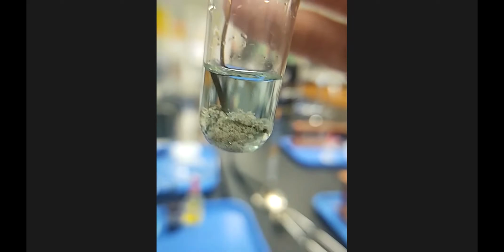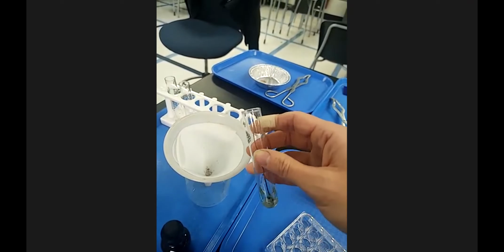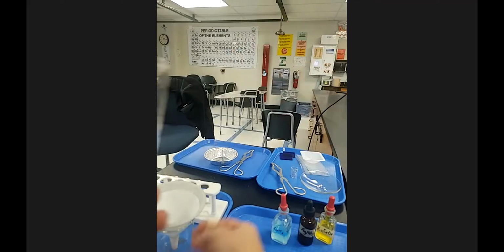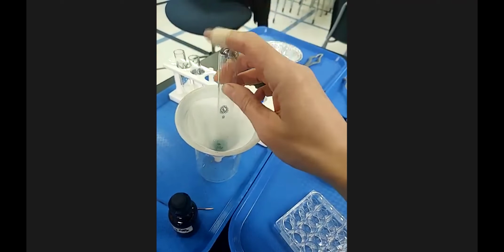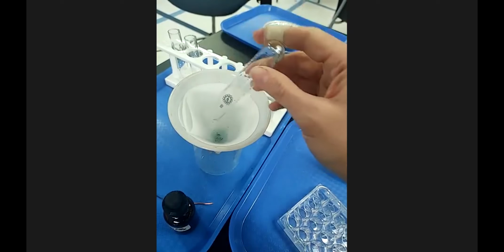And for station 1 for cleanup, it says to, now you guys would just take your whole thing and dump it down in a beaker that has a filter paper. So I'm gonna pull out the copper, though, because this is a much larger piece of copper metal than you guys would have had. I'm just gonna set that down. And then this is what I'm gonna dump. So if it says not to dump something down the drain, there's probably another area. And there you can see the color of the liquid that was in there.